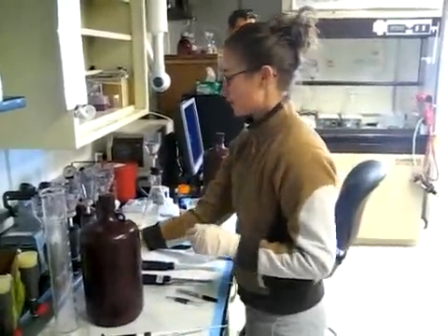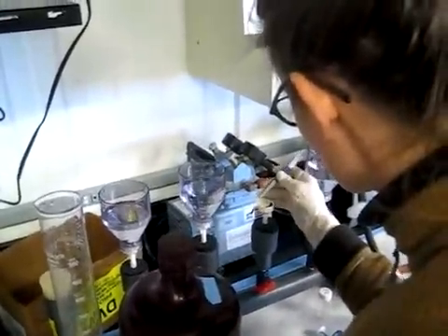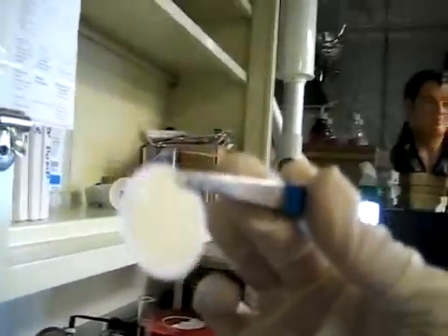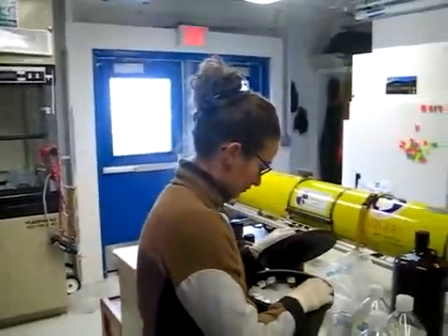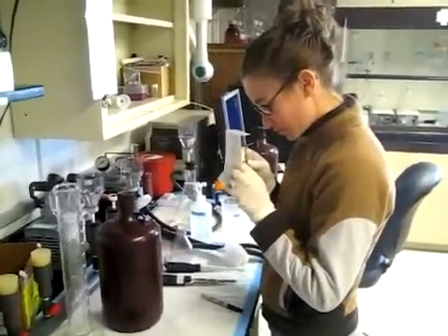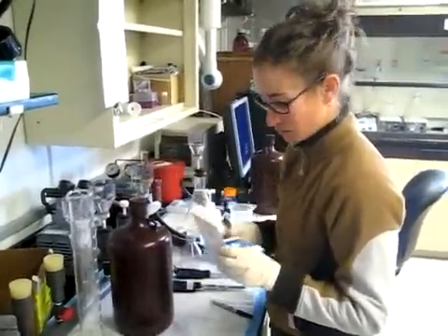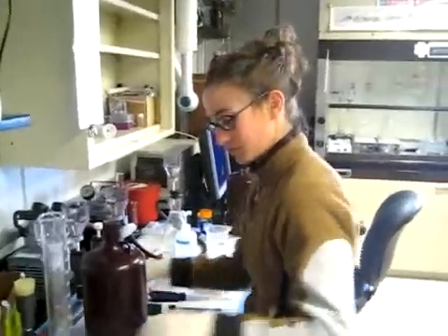She'll show us the filter right now — it's a little brown, maybe not so green. It doesn't come out so well on camera; it looks white but really it's brown. We will analyze the samples later in the week for chlorophyll content. We're also setting aside samples to look at the polysaccharides in the water, and we have other samples set aside for cell counting and DNA analysis, as well as the nutrients such as nitrate and phosphate in the water.